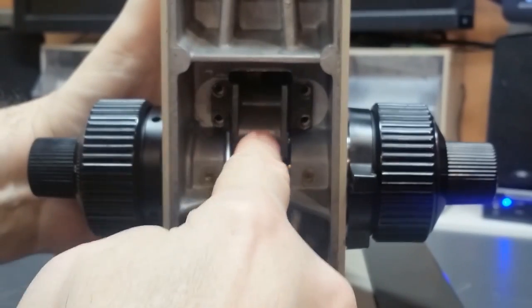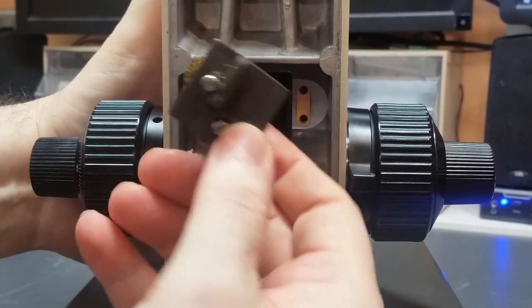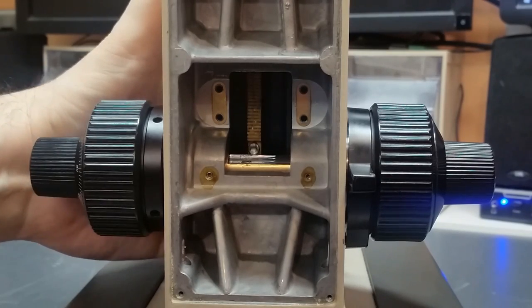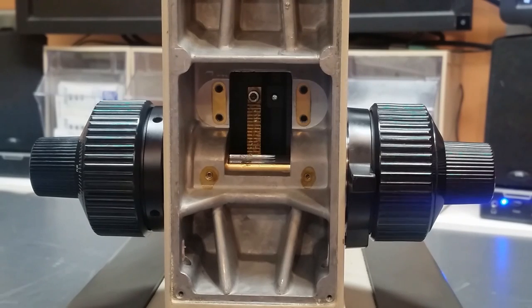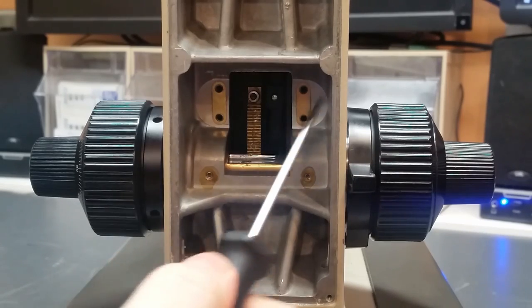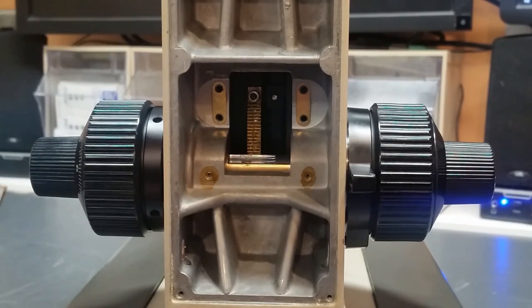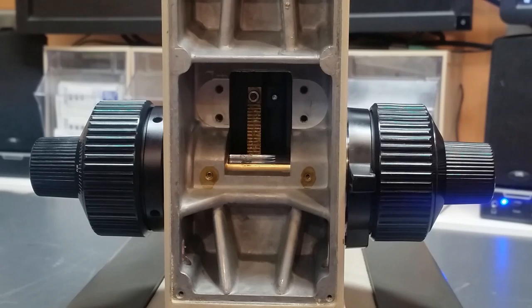So there's screw four. Here's the gearbox. It came out. Now if you look in there, you can see that I'm going to let the focus block down so I can let go of it now. Inside of here there are two brass shims. Those will either stay in place on the walls of the casting. Sometimes they may come out here, but regardless of where they're at, I need to account for them and take them out so they don't get lost during the rebuild. And that's the removal of the gearbox.